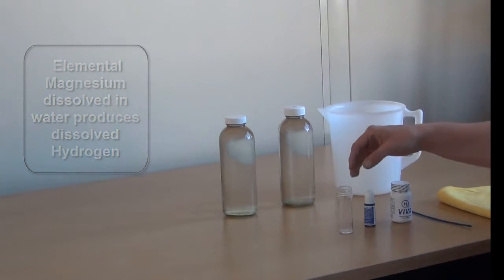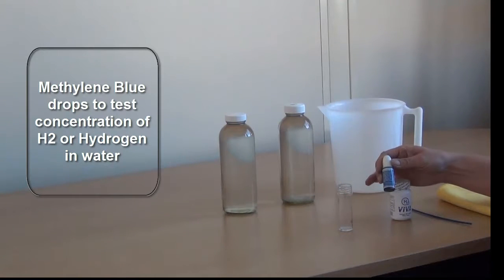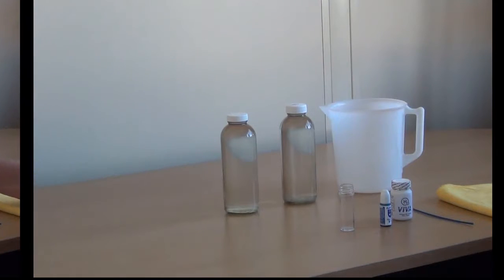The H2 reagent drops that we are using are methylene blue. They are a convenient method that can be used to test the concentration of hydrogen in your water.